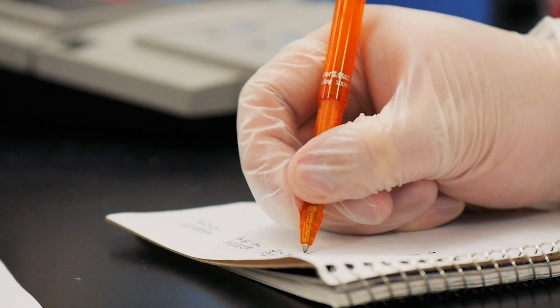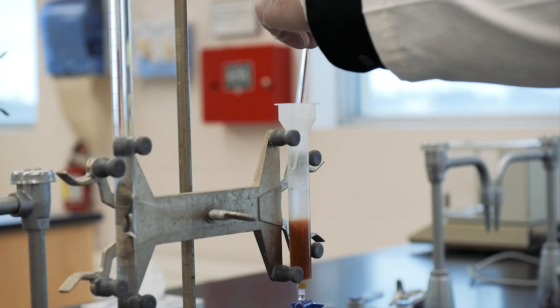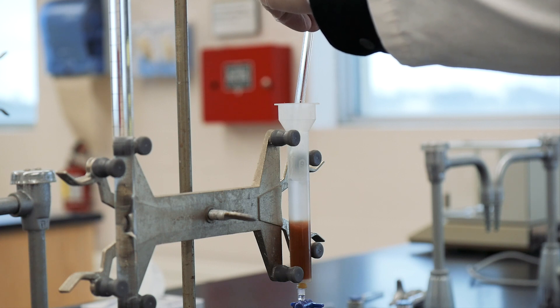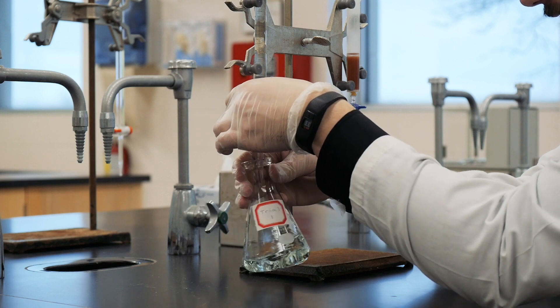As always, note the volume from your burette when this happens. Now repeat the procedure starting from when you activated the ion exchange column with the hydrochloric acid until two separate titrations are both within 0.1 mils of each other.